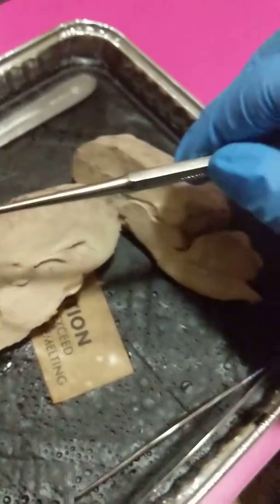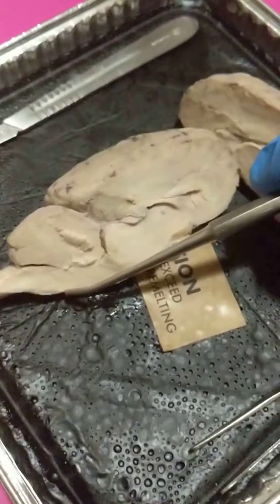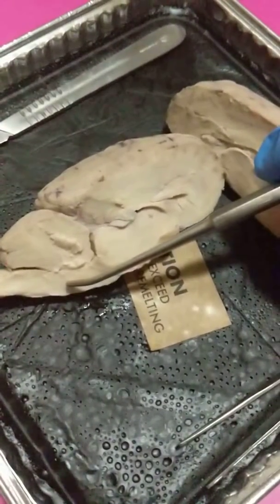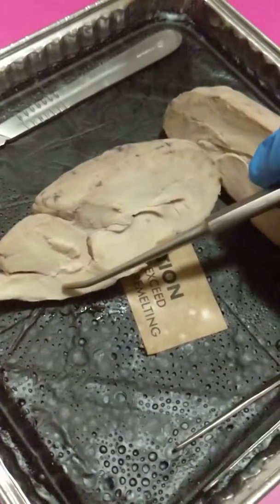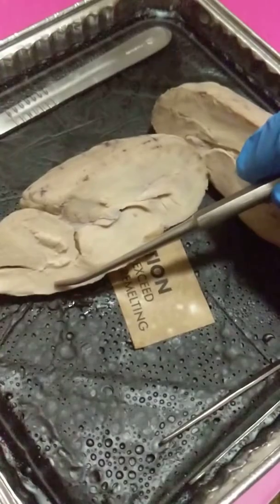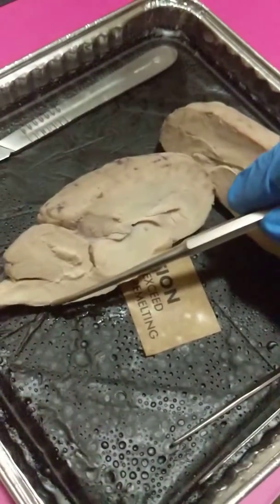The medulla we have right down here. So this is the most inferior part. This contains centers that help control blood pressure, heart rate, and also respirations for breathing.